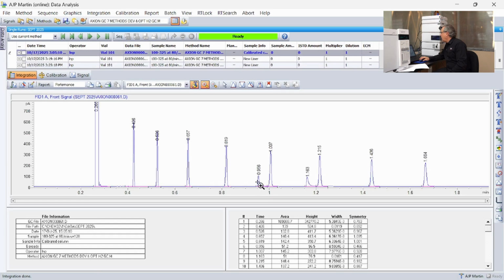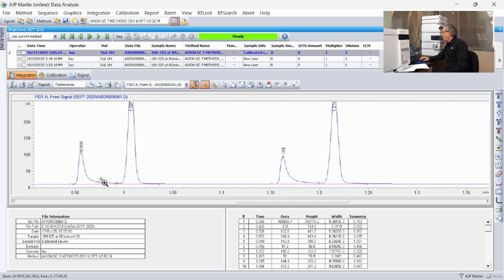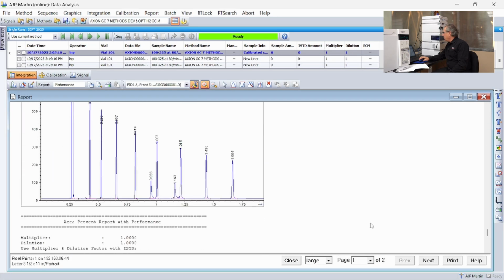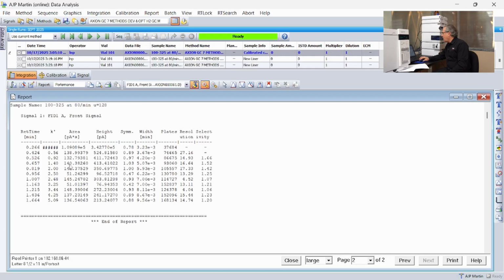Yeah. So clearly looking at it, we know it looks a lot worse than what we're dealing with right now. But if I tell it to go ahead and show me the report, it will show me the report on the screen. And again, we get the lousy looking chromatograms, but let's look at our symmetries. Remember, they're supposed to be close to 1. So we got 0.97, 1.0, 1.0, 0.47, 0.93, 0.42. Those are horrendous. Those are the alcohols. 0.93, 0.89, 0.88. So that's what we started with.